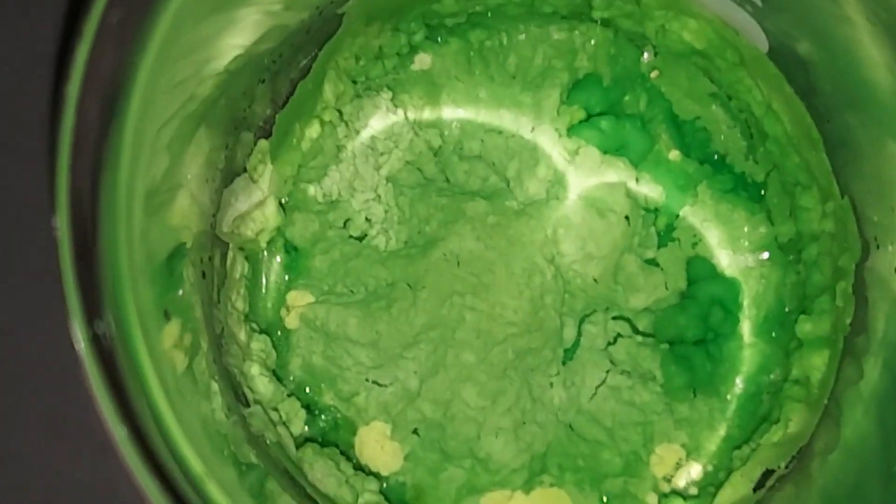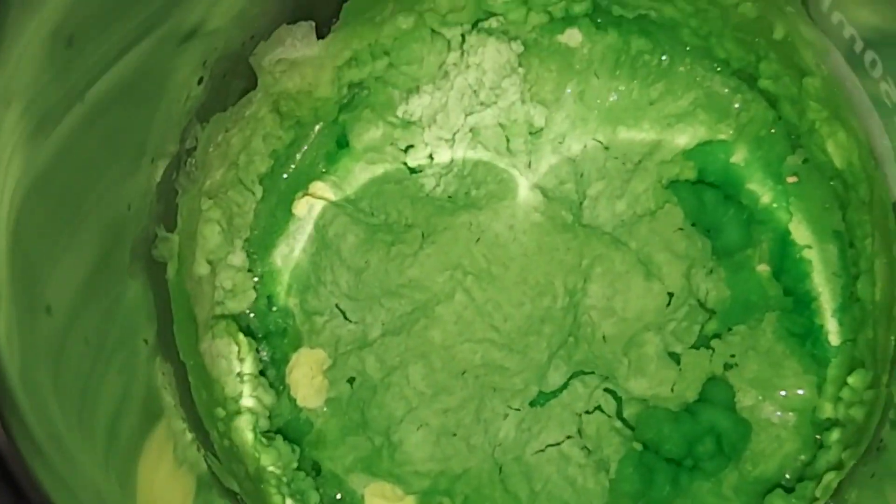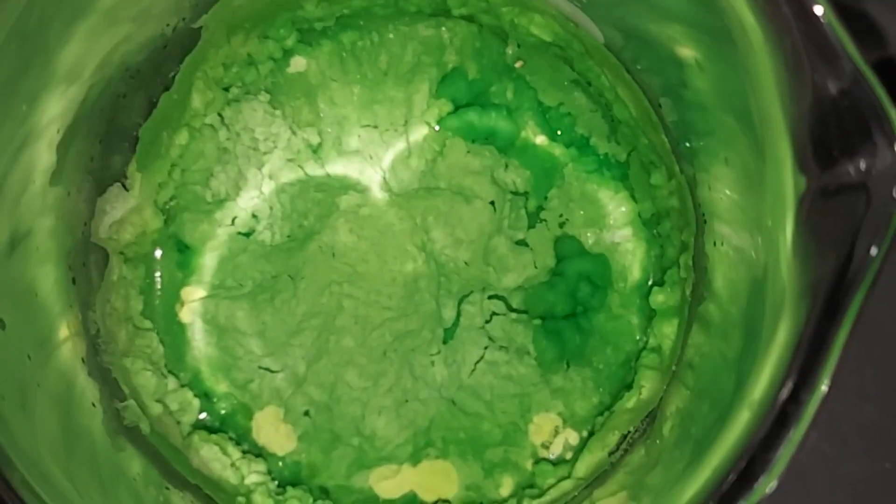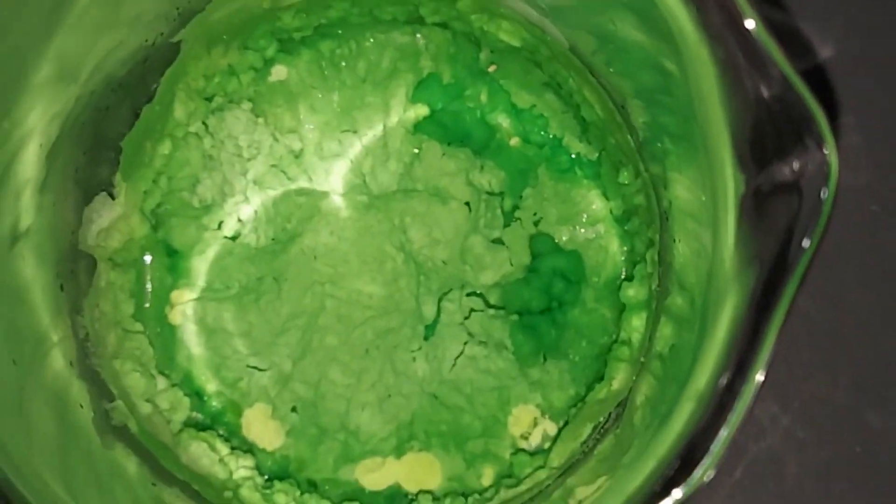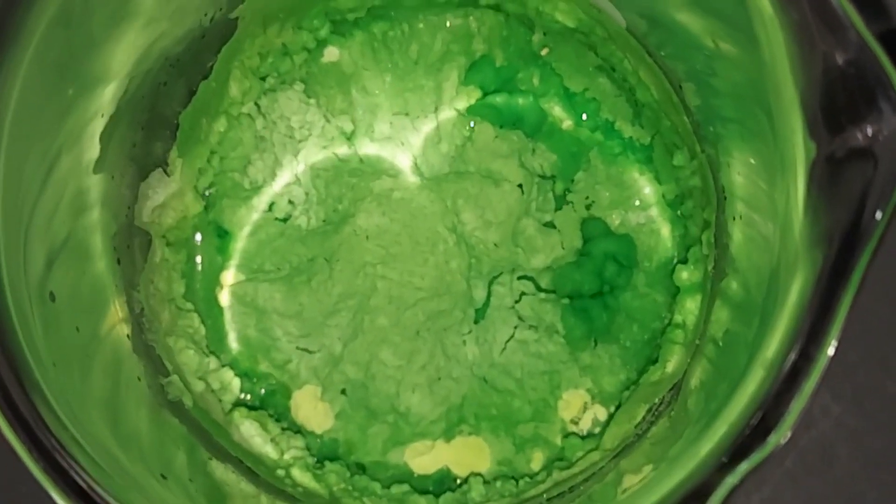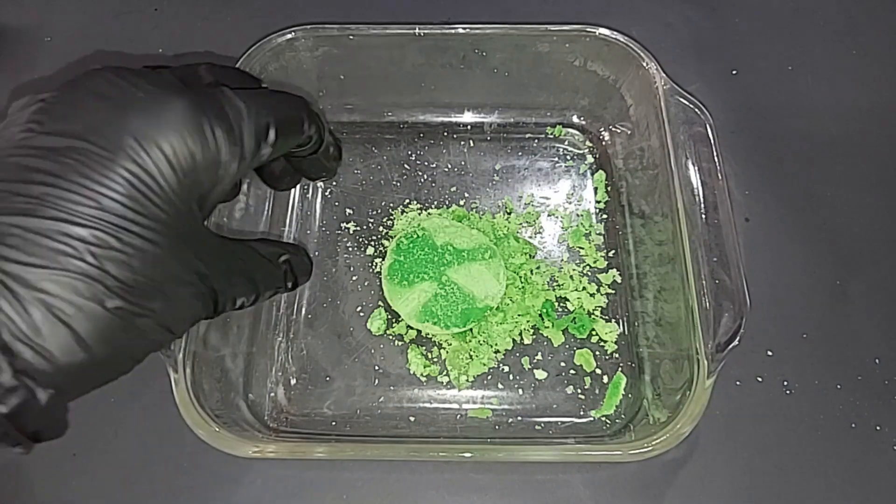So I think what I'm going to do is scrape it out of here and take a good look at it. I may not vacuum filter it, I probably won't vacuum filter it at this point. If anything I might recrystallize it, but I'll even question that. So we'll see what it looks like when I scrape it out.